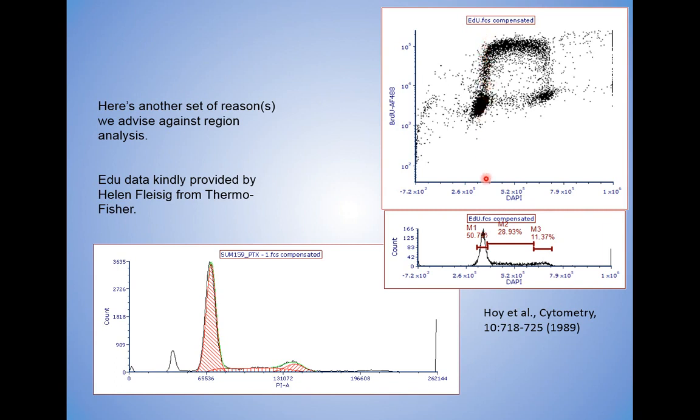Region analysis is assuming these populations are discrete and separate, and they're not. They're actually piled up in back of each other when looking at the data in this manner in a two-dimensional view. So all of this incorporation in here is wrong. It's wrong here. Those numbers are also going to impact how this comes into play. This is the second nail in why we don't want to see people doing region analysis. Let the cell cycle modeling software do it.